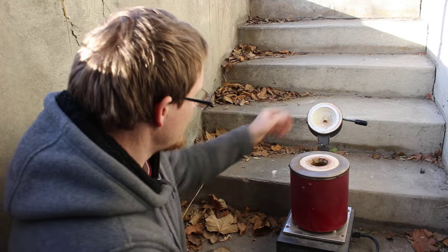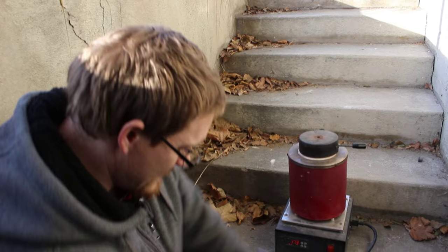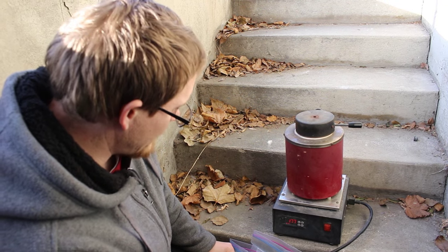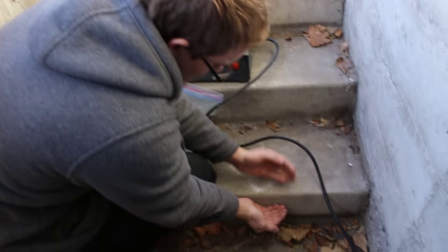All right, let's close this up. Let it heat up over the next probably an hour or so. And in the meantime I'll clean up all these little lead chips that I spilled.